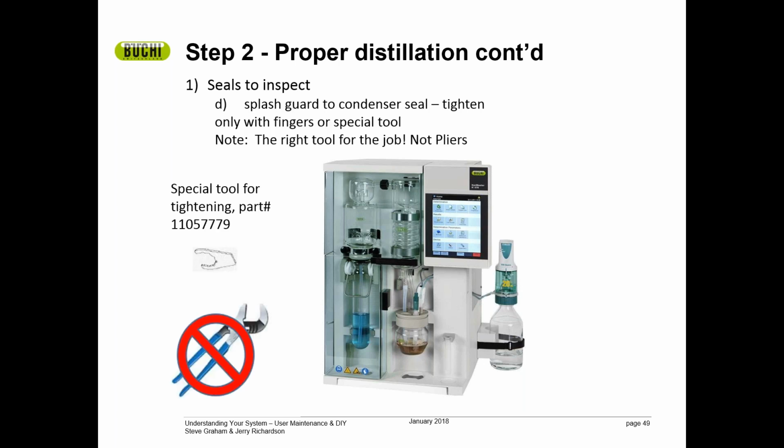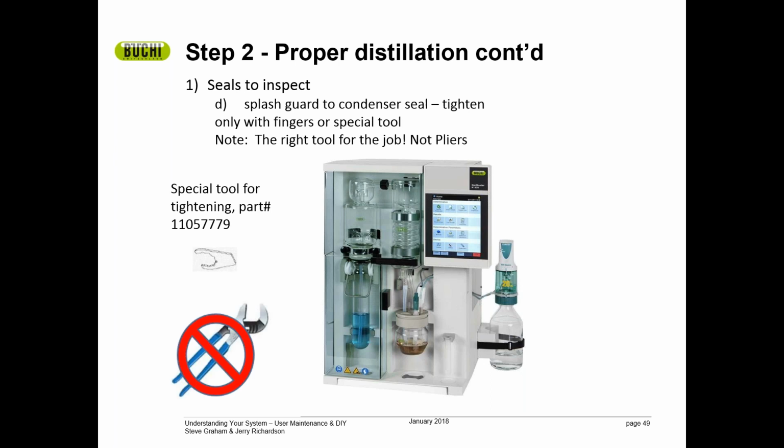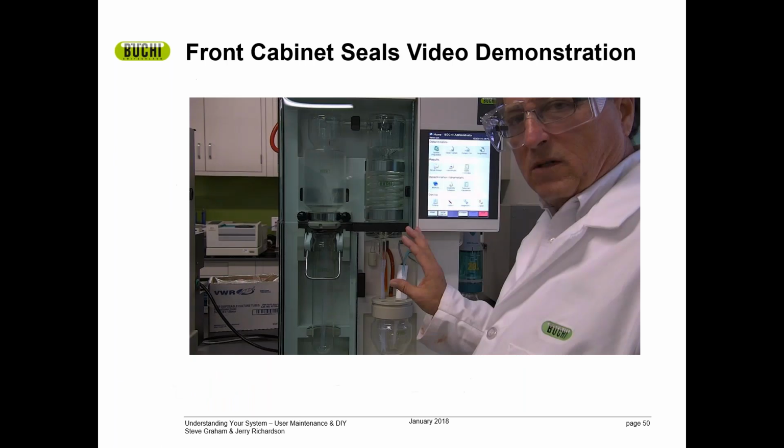The other seal to make sure that you check is the condenser to splash guard seal. And please use our tool to tighten this seal. The part number is here on this slide. Please order one. If you don't have one, please do not use a pair of pliers on this fitting. All it does is break the plastic fitting or break the glass. Now let's take a look at the video explaining the seals on the outside of the cabinet, on the face of the cabinet.